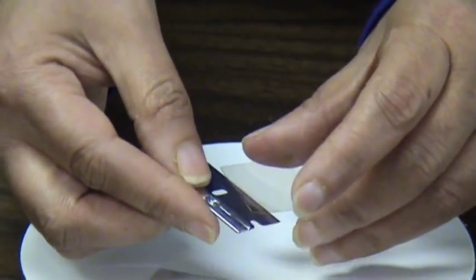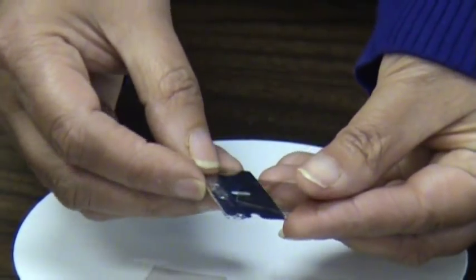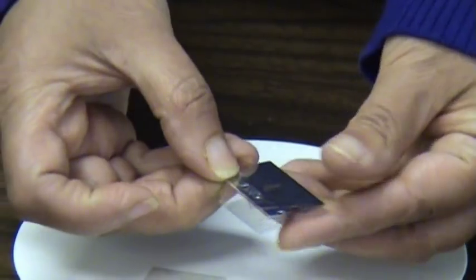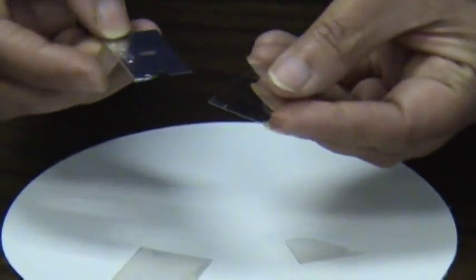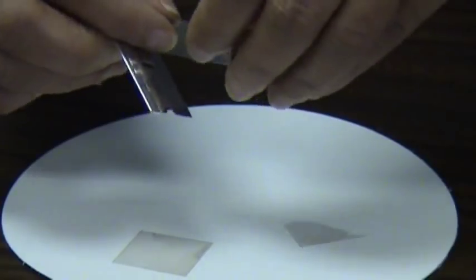Trying to cut mica in either orientation will likely cause fracturing of the material and create smaller mica flakes and particles, something not desired in a substrate.